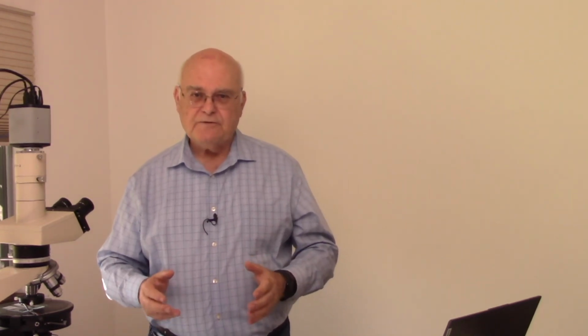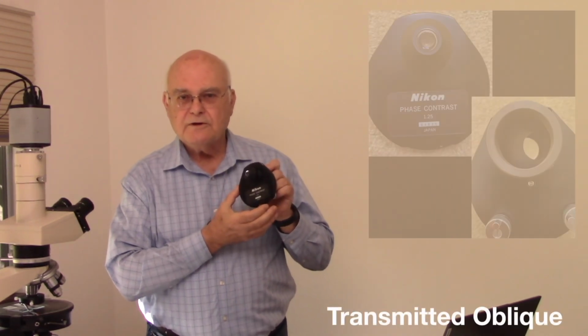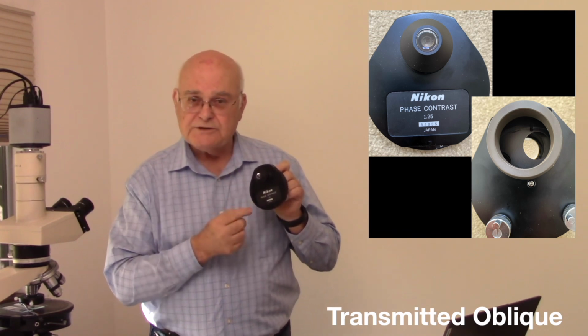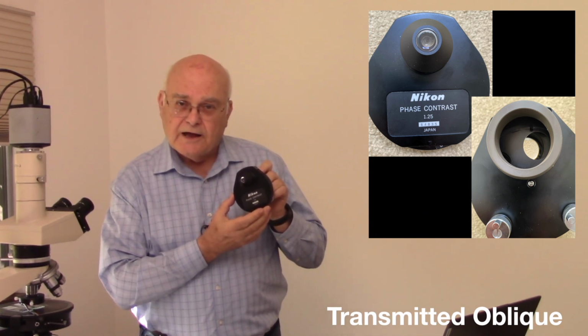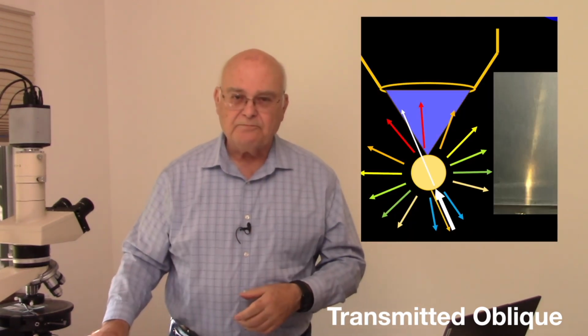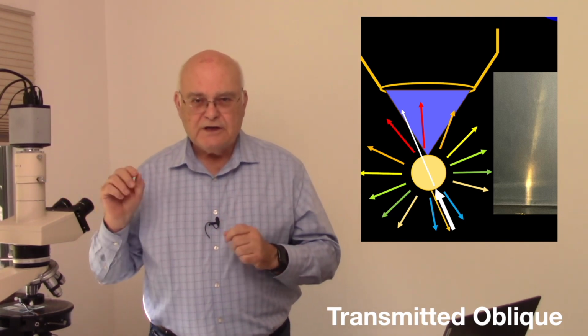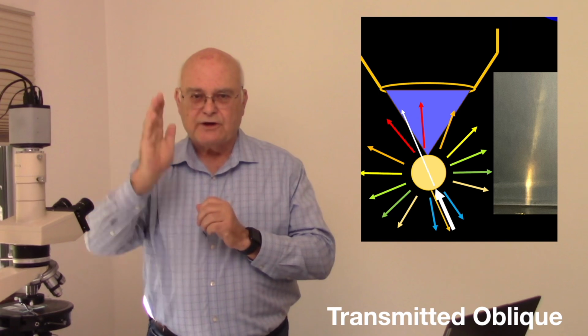Now there's another way that we can illuminate the field, and that's by using oblique illumination. To do that, we take our substage turret condenser and we rotate it slightly between stops that are built into the scope, or built into the condenser. At just the right position, we get a beam of light that comes through our particle at an angle. Now, again, here on the right side of this image, you can see that the light is at an angle rather than coming straight through.